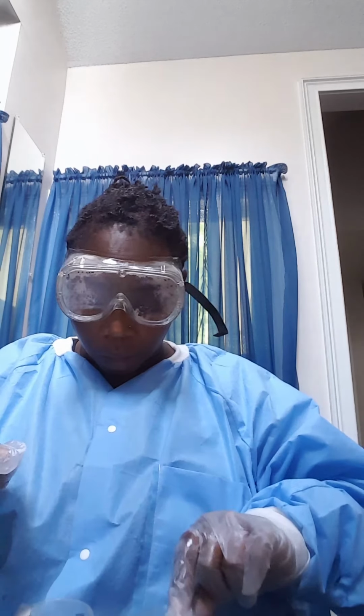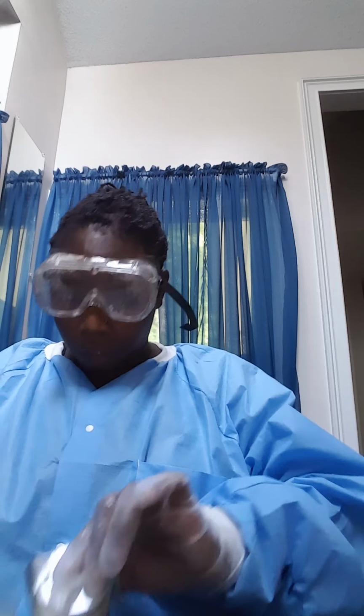So this is my dilution to 1. And then this is my 2, for the times 2. For the times 3. This is for times 4. For times 5. And times 6.